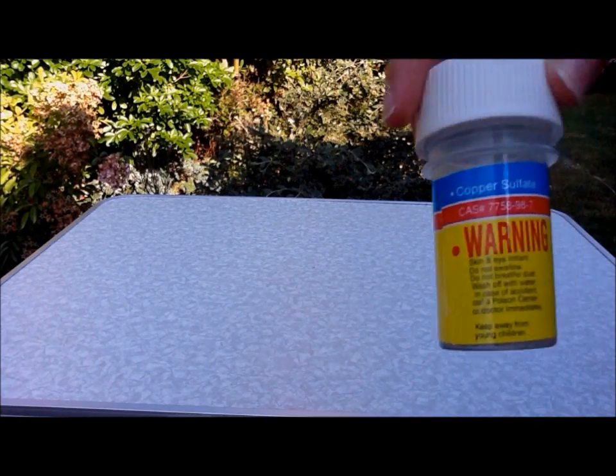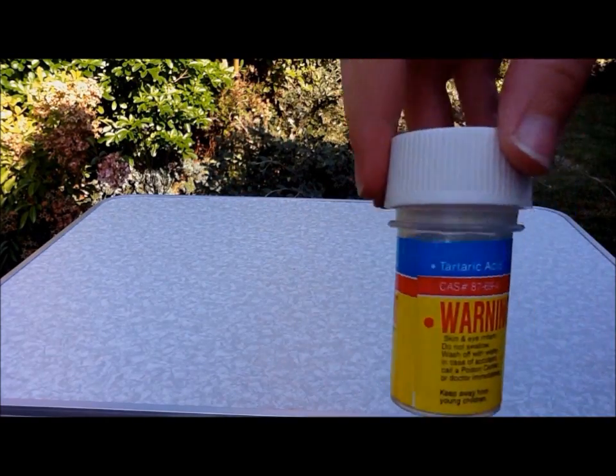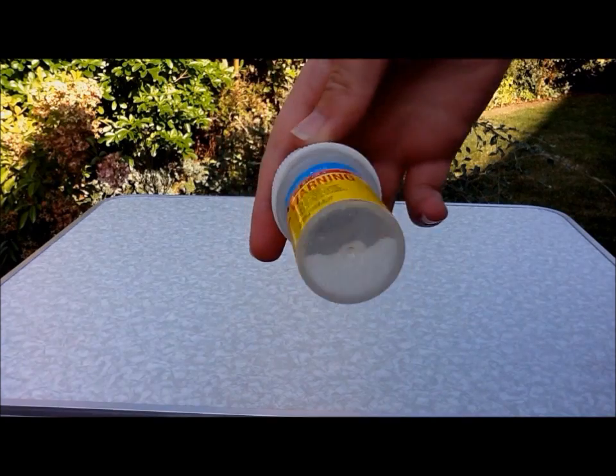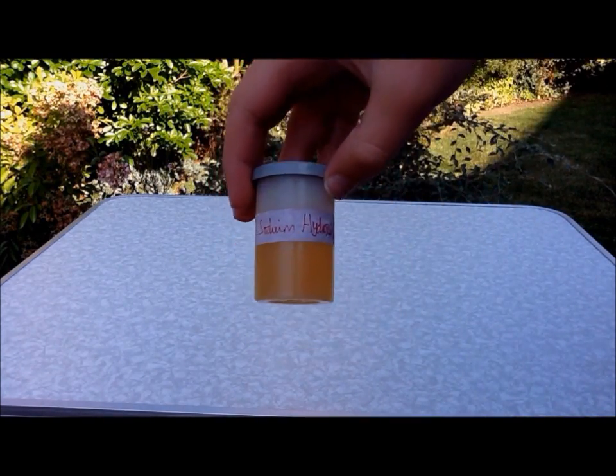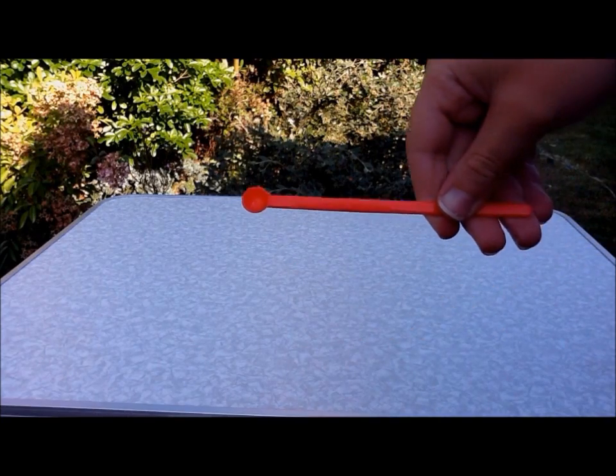The things I need for this are copper sulphate blue crystals, tartaric acid, a very weak sodium hydroxide solution, two test tubes, a syringe, a small spoon, and a little bit of water.